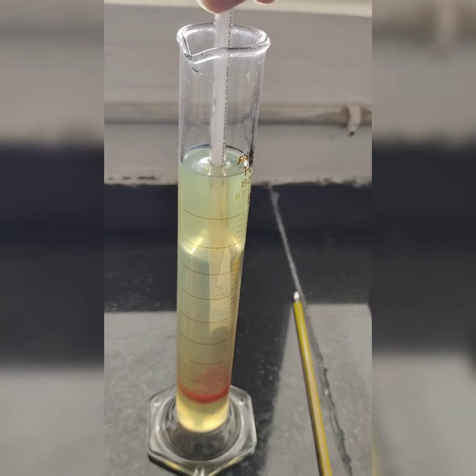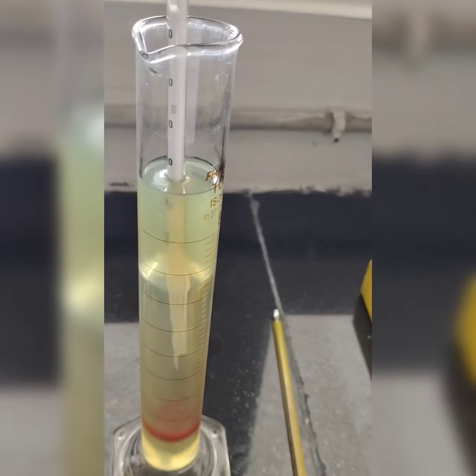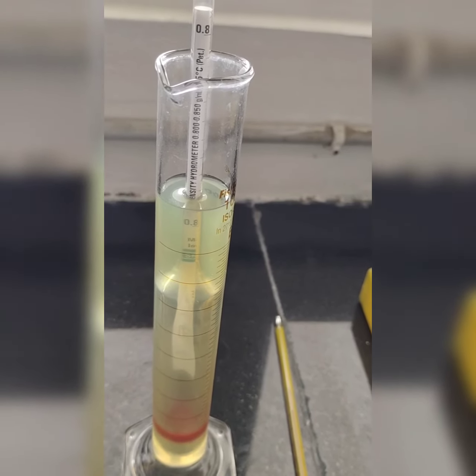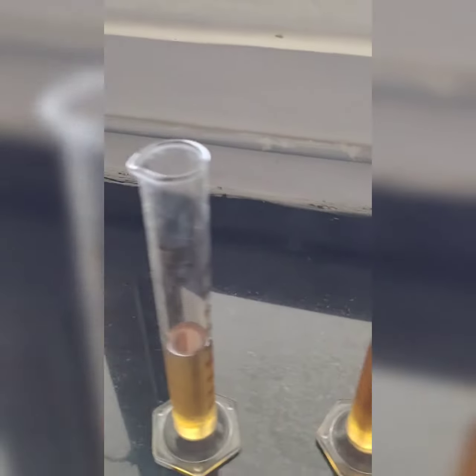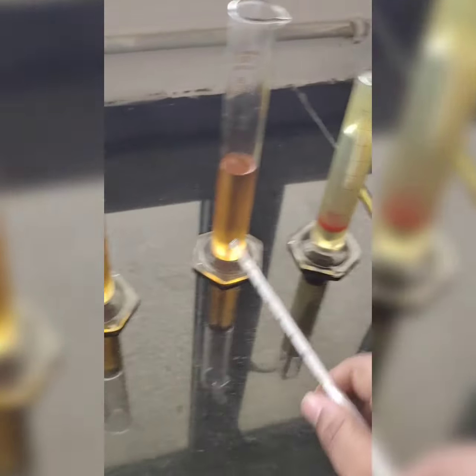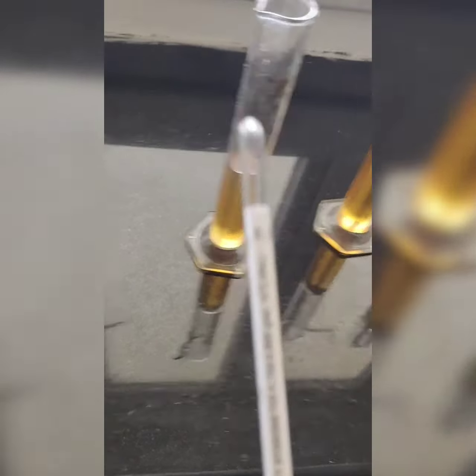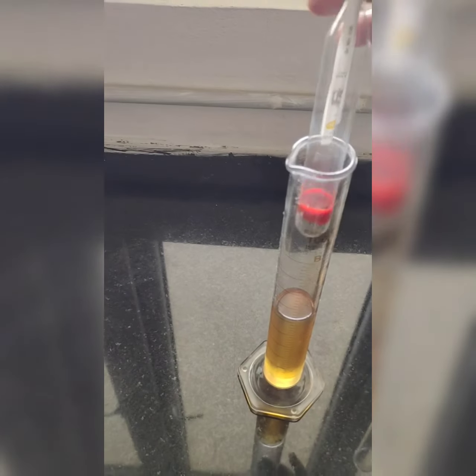So you can compare this. One thing you can do, you can swirl it and you can keep it inside. Okay, this one we have kept, and this first one is a little denser. This one is very light, and this one is between these two. So I will give a hydrometer which is between 750 to 800. So I will keep it in this.